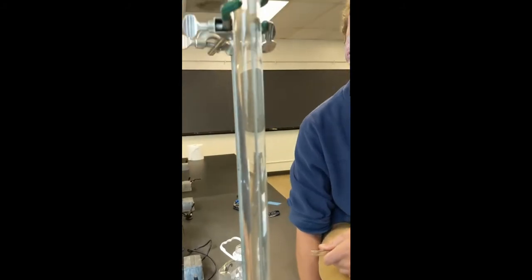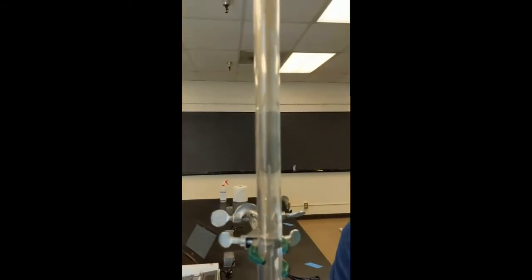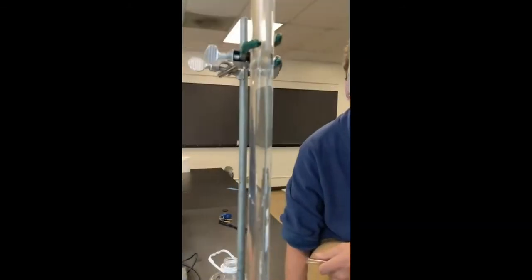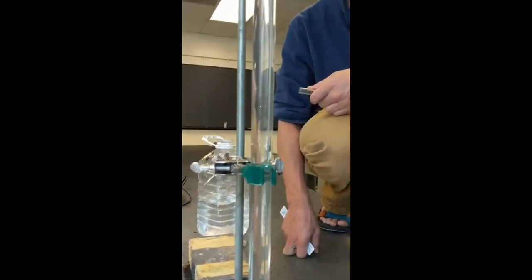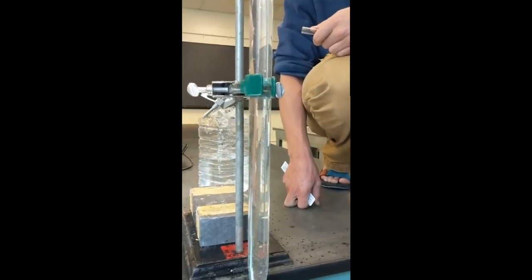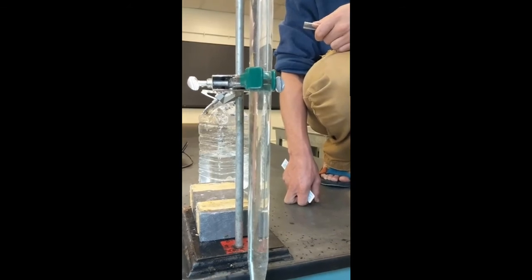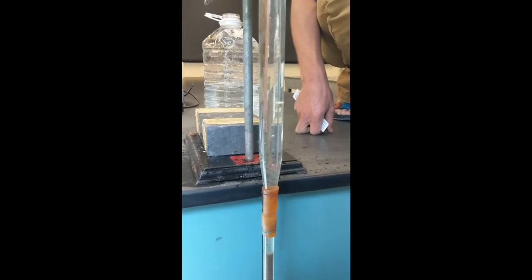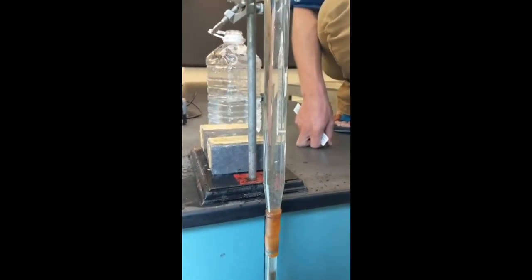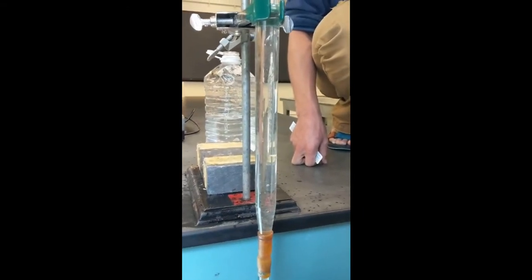Now, let's look at this tube right now. You can see there's lots and lots of sediment still suspended in the water. The physical law we're working on here is that within a column of water, particles that are larger and heavier settle at a faster rate. As you all know from physics class, in a vacuum, things that are heavier do not fall faster than things that are lighter. However, in a column of water, they do. So the sand and large particles are going to fall out first and accumulate at the bottom first.